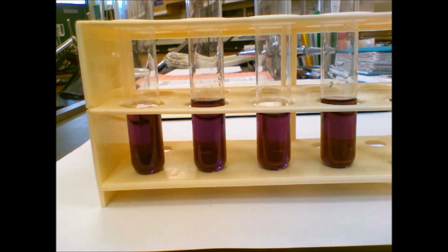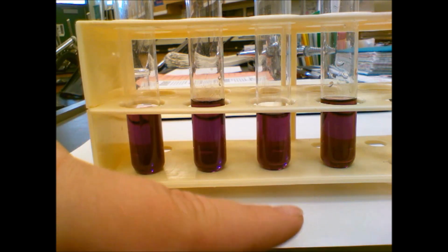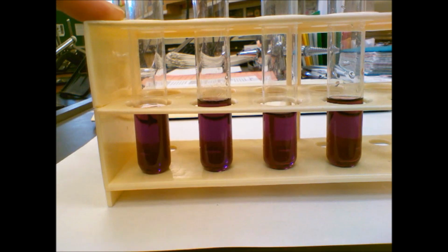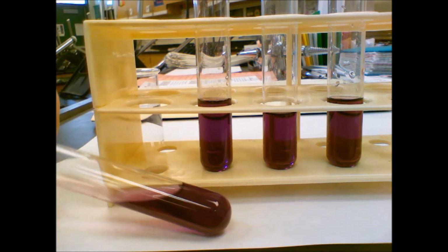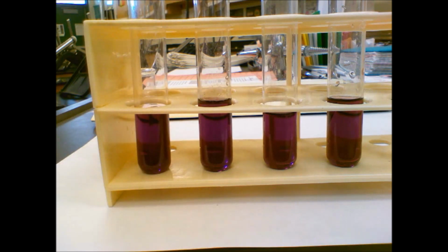Gotta keep an eye on my hot light. Okay, so we've got 4 different test tubes here. We're going to be testing each one of them with different things. You can see on your chart there it says the stress and then the initial color, final color, and shift direction. So we're going to start with this first test tube here on the left. Its initial color we can say is purple, starting out with that purple color. You can see that. And we are going to add about 10 drops of water to that test tube.